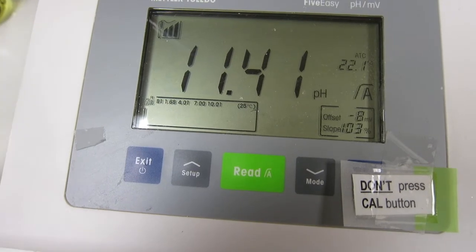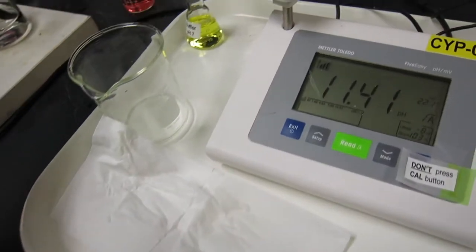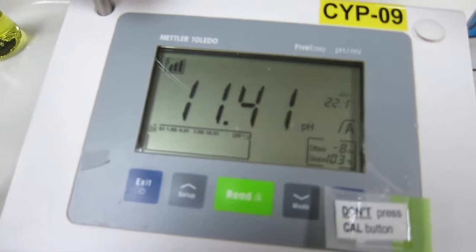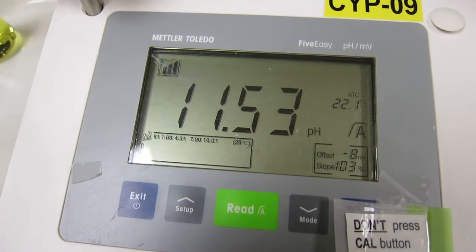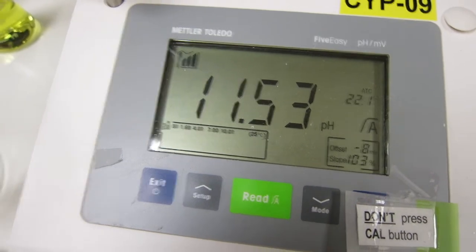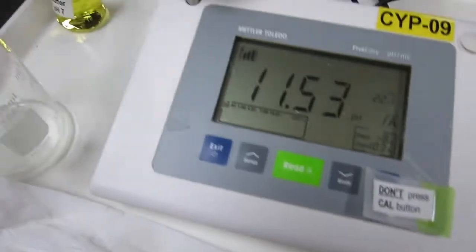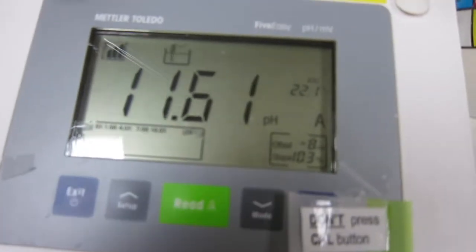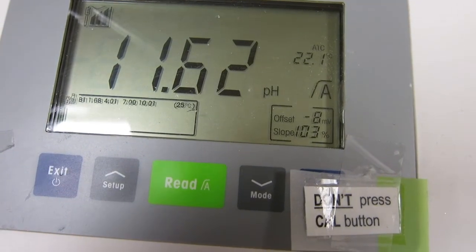The pH is 11.41 at 27 mL. At 28 mL the pH is 11.53. At 29 mL it's 11.62.